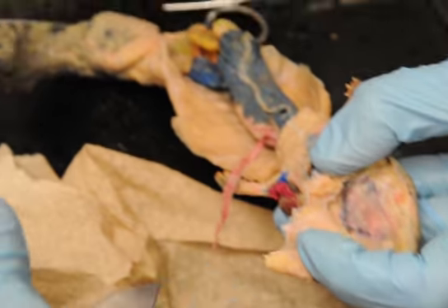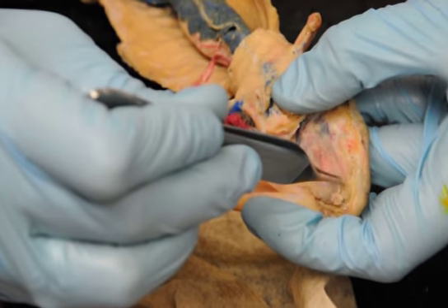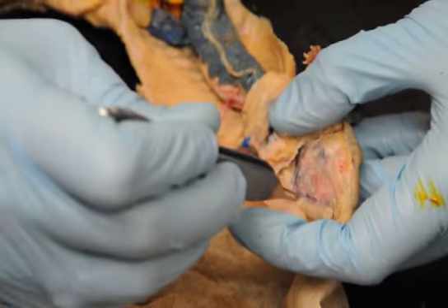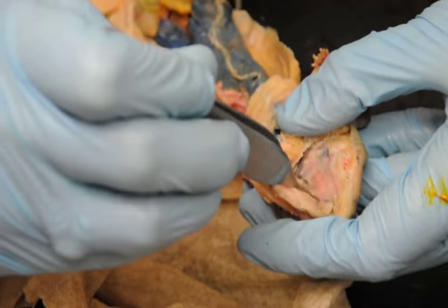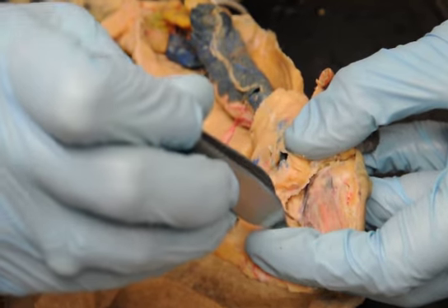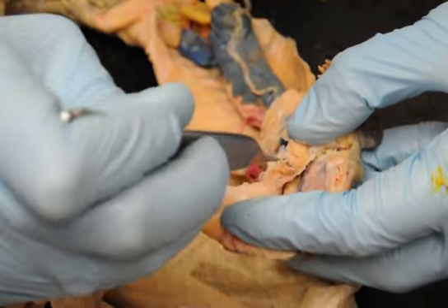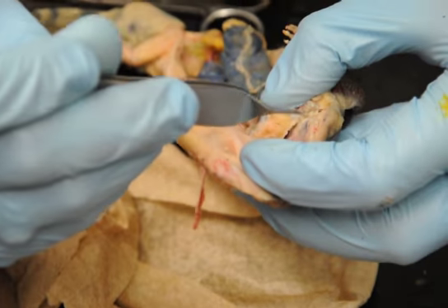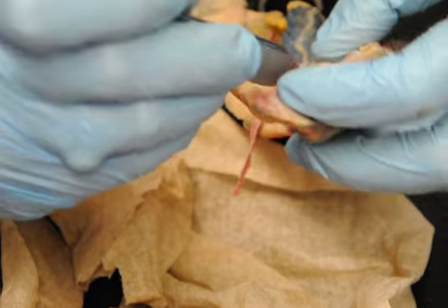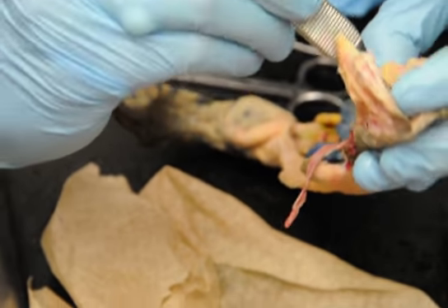So the ones you can usually see best going up the middle here, that's the internal carotid. You're not really going to see vertebrals because they're too thin and they don't get injected. And that's really all you're going to see. Sometimes you'll see your externals, sometimes they're on this side. The radix aorta, right? Yeah, the radix is going to be in here.